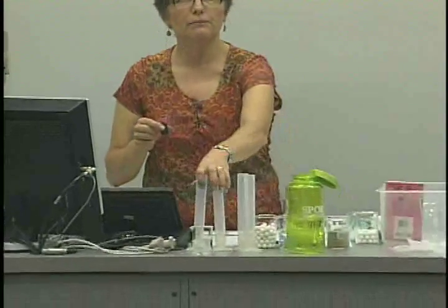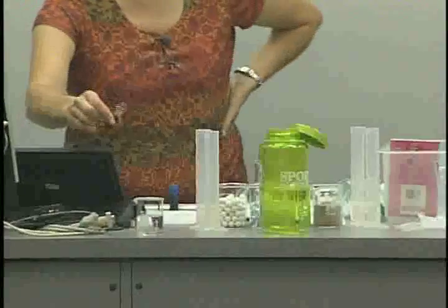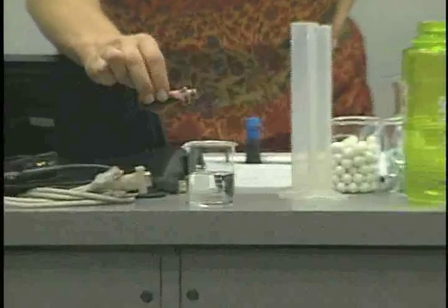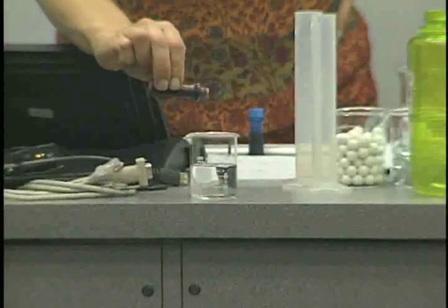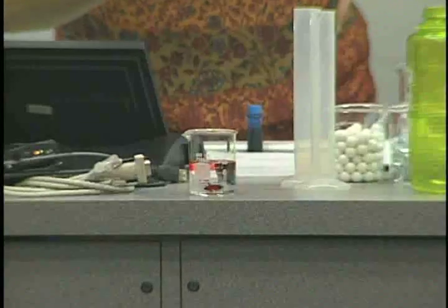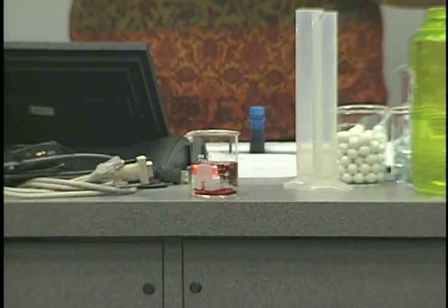And you know what? This might actually work better if our cameraman Steve kind of zooms in on this beaker down here, and let's see if we can see what happens a little better than on the document camera. So, okay, here's a drop of food color. And yeah, I think that's better. So we're going to observe that just for a little bit.